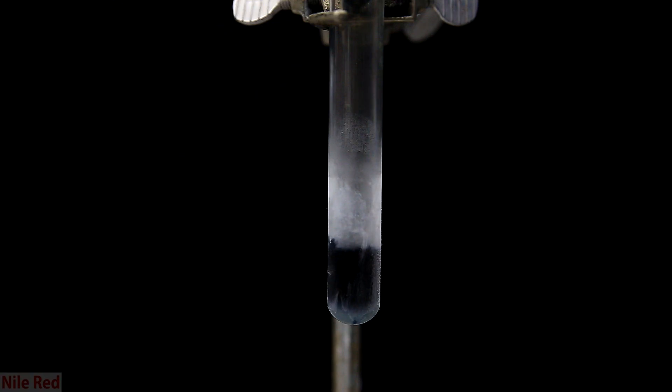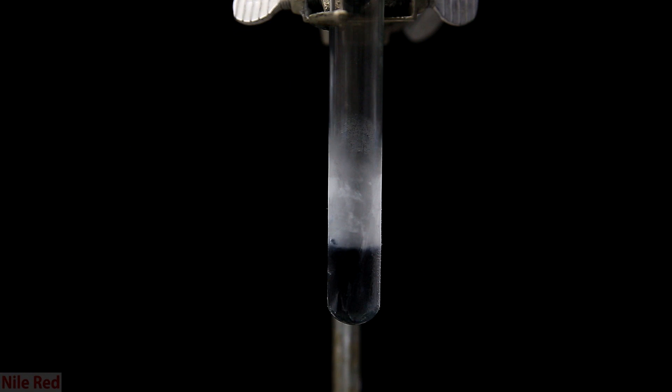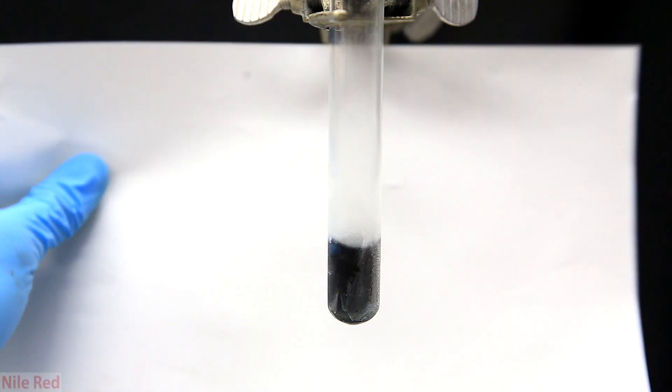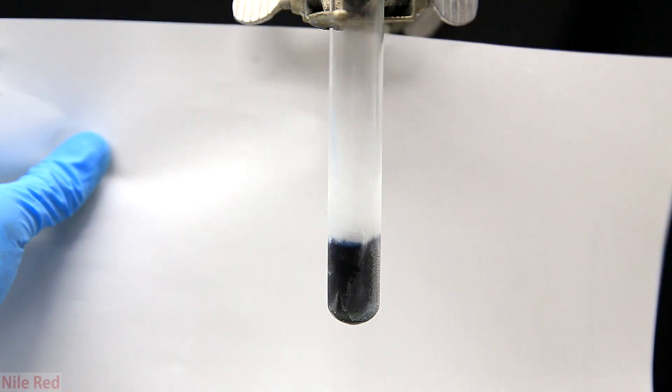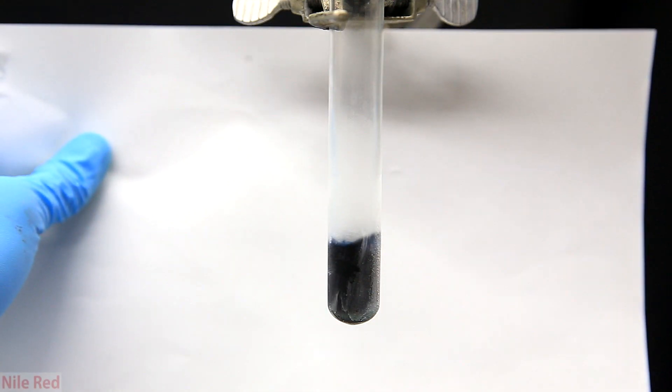After most is dissolved, we're left with a blue color, but to give it that metallic bronze, we add a little bit more sodium. And just after reacting for several seconds, it starts to take on that bronze color.